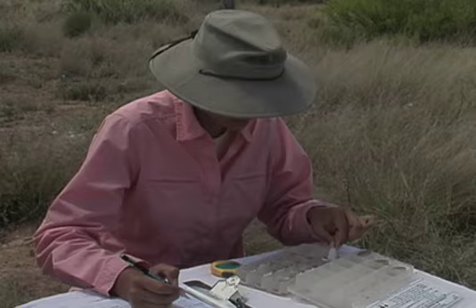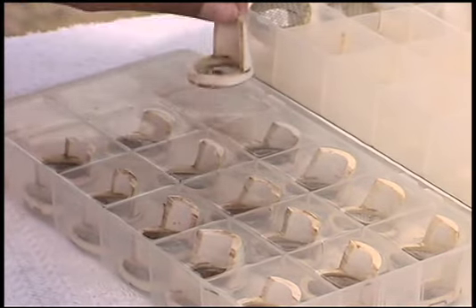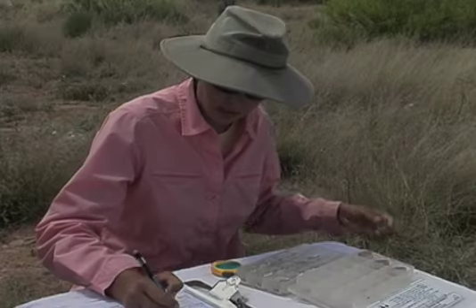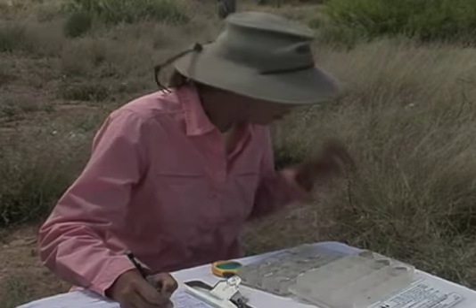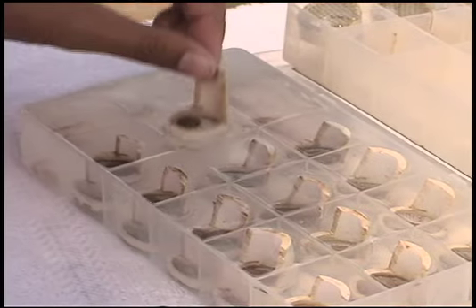It should take 10 seconds to dip the sieve in and out 5 times. Give the sample a rating, blow out the sieve, and move on to the next sample.